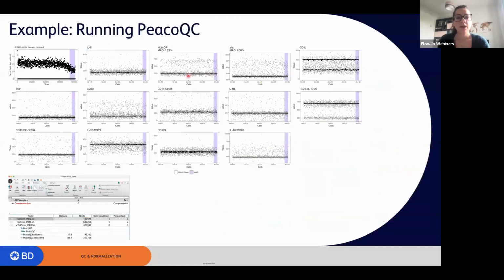Okay. So this is one of the examples of output when running PeacoQC. As you can see here, you have information about the number of events that were removed when using PeacoQC. And where you have this violet line, it's basically the interval of time where the events were removed. You can see here the flow rate actually goes down, and that's what creates the removal of the events, and the median value deviates. And here you can see all the different markers that were used and how the flow rate, the signal basically was for each individual marker. Again, what you will have in FlowJo will be an output made of bad events and good events.